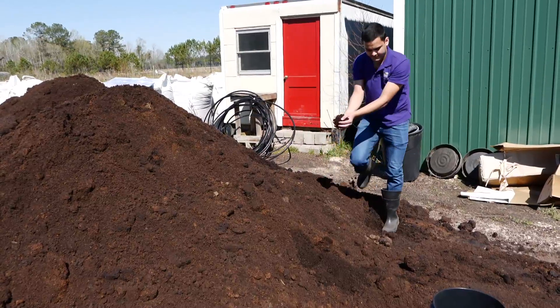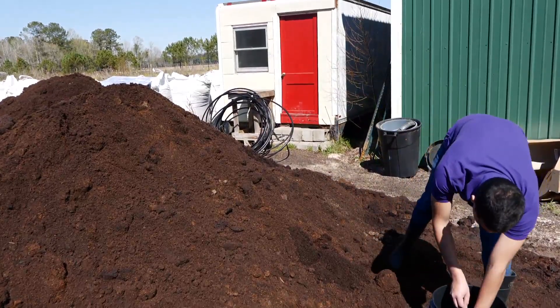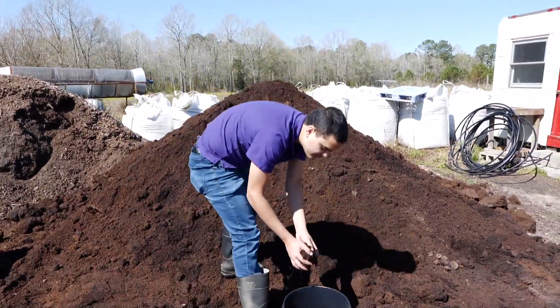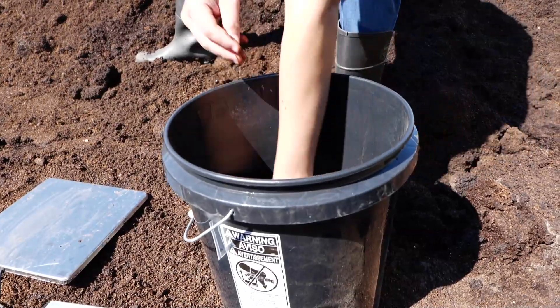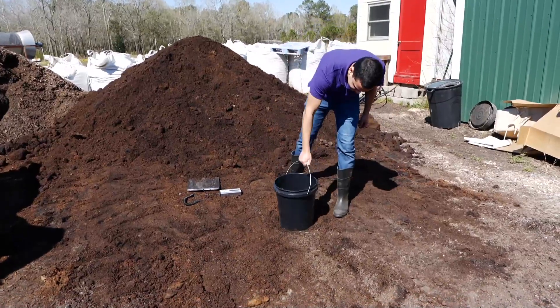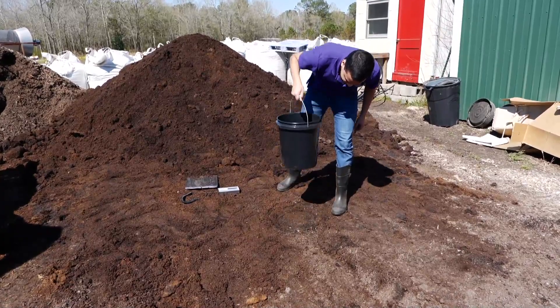Step 3: take handful samples from several locations in the pile to obtain a representative sample. Fill the bucket with compost to the one-third line. Drop the bucket ten times from a height of about one foot.